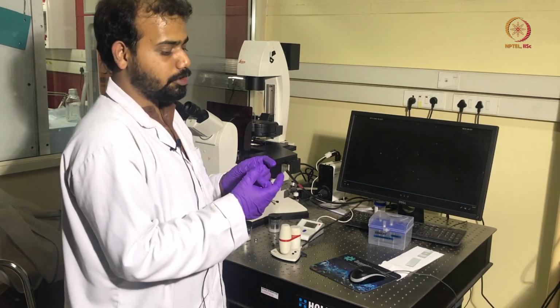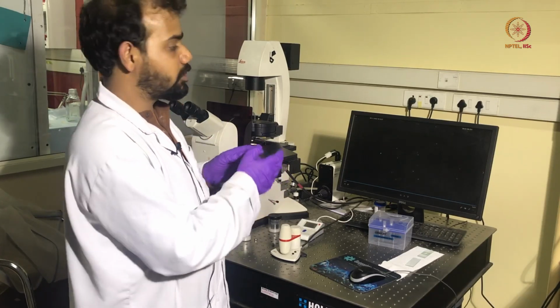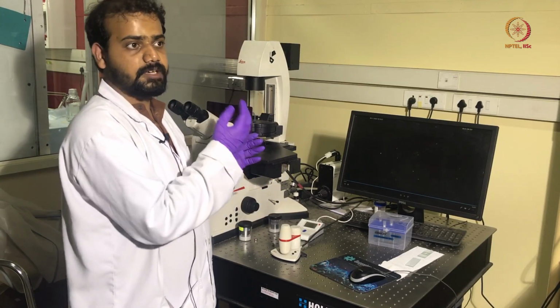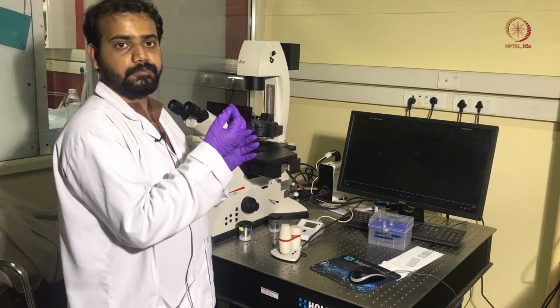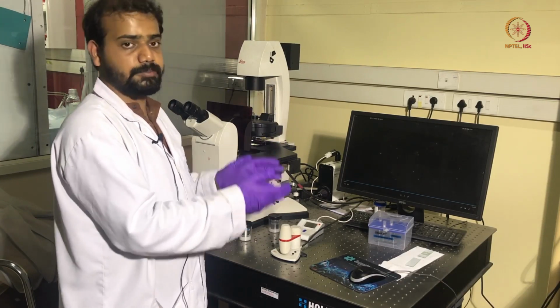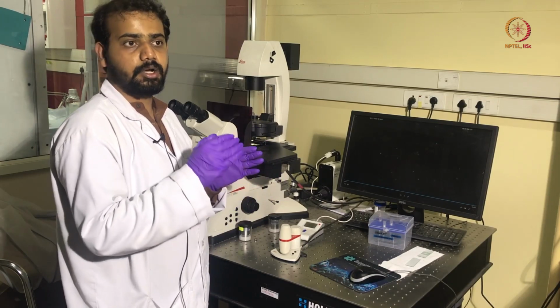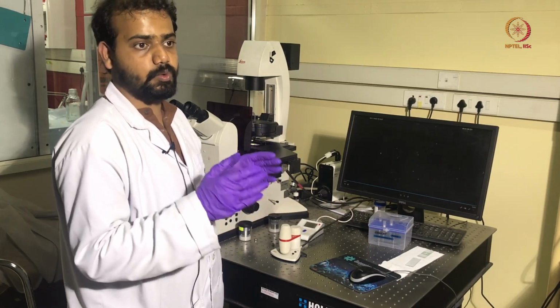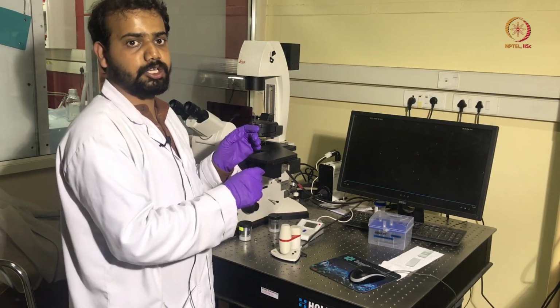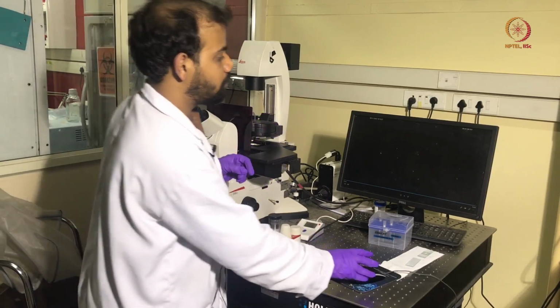So this dichroic mirror will separate the 542 nanometer light from this white light source, and it will allow it to reach the staging area where the particle will receive this 542 nanometer light. Since these are fluorescent particles, the particles will be excited and emit light of a lower energy, around 612 nanometers. And again that 612 nanometer light will pass through this dichroic mirror and reach the camera, by which we can see the motion of this particle.